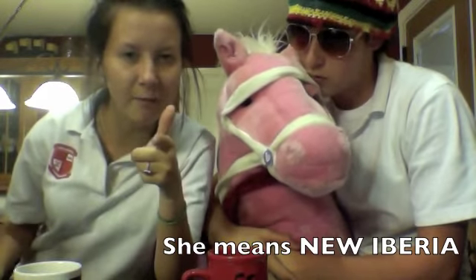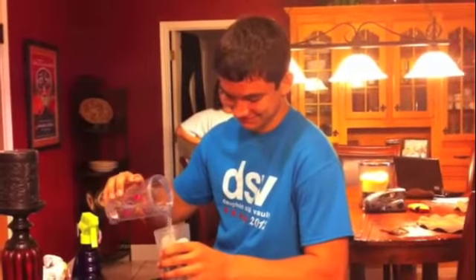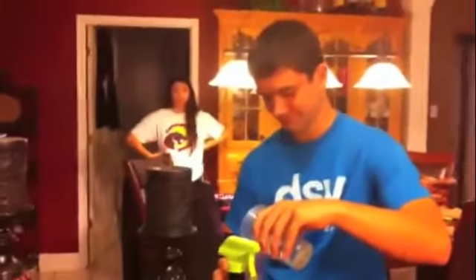To make sure this does not happen again, we have to teach you chemistry students of America the lab safety rules. Rule number one, do not touch anything or anyone with anything in the lab. Number two, never eat or drink in the lab, period. Only perform experiments authorized by the teacher. Four, never fool around in the laboratory. Never.